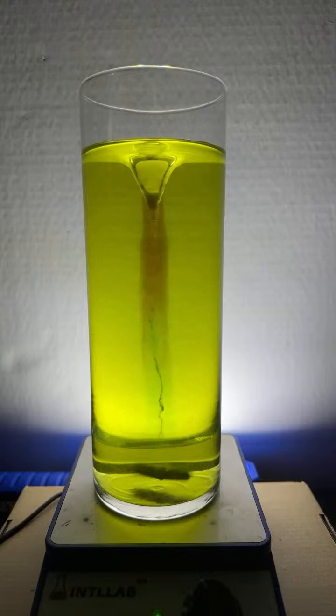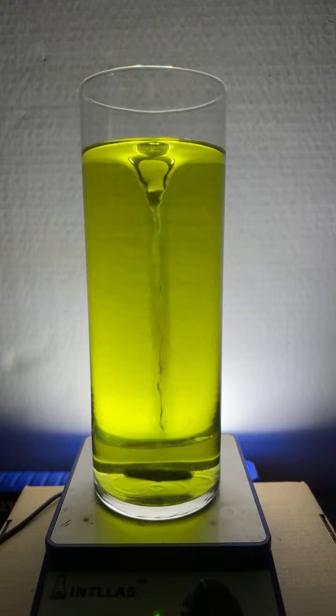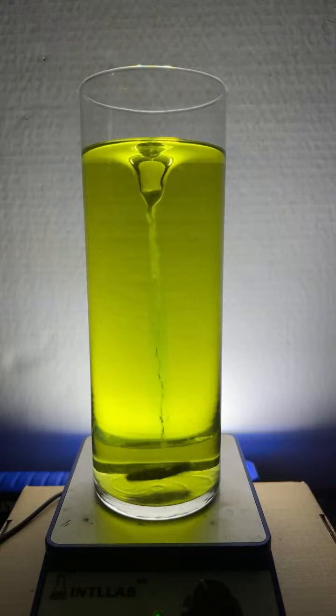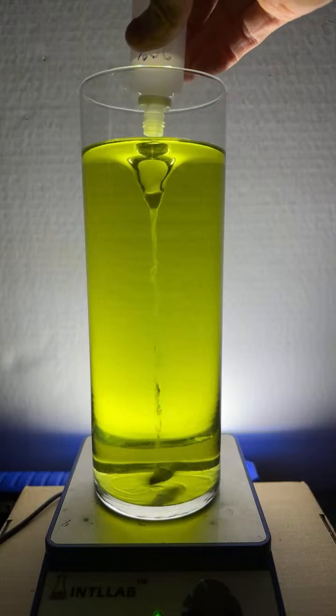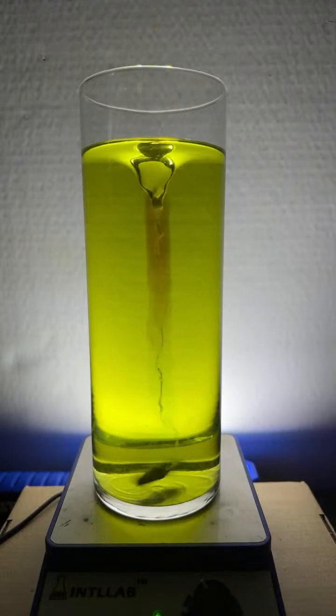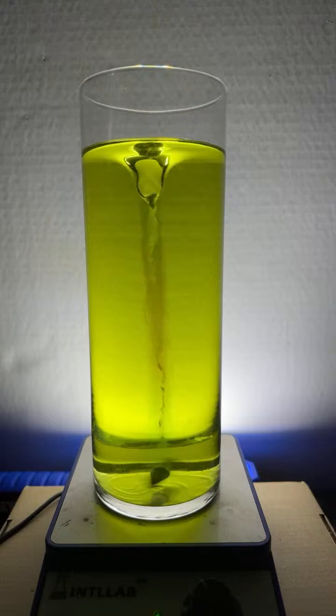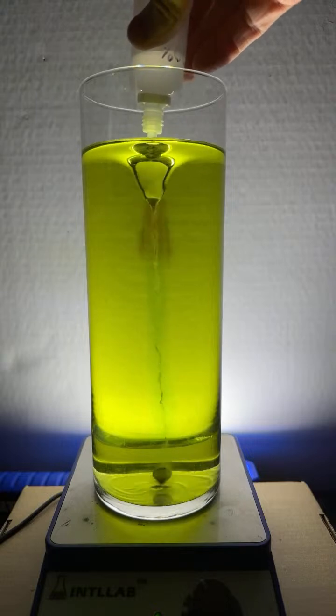They go away because the bubbles are full of carbon dioxide. And remember, I told you the carbon dioxide reacts with the sodium hydroxide that I added. And so the bubbles are consumed. So in this sense, sodium hydroxide is acting as what we call a carbon dioxide scrubber. It removes the carbon dioxide from the gas phase and actually dissolves it into the water. And people are studying how to use these in industrial processes so they could put carbon dioxide scrubbers in smokestacks. And as the carbon dioxide moves through the smokestacks, it'll get removed by the carbon dioxide scrubbers.